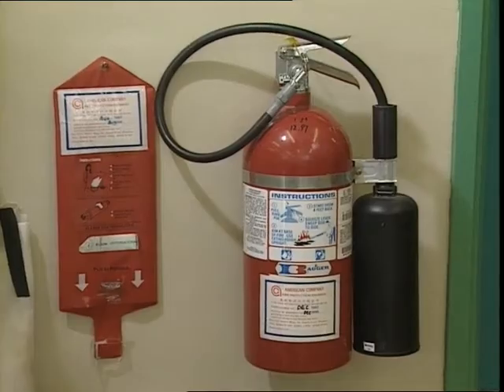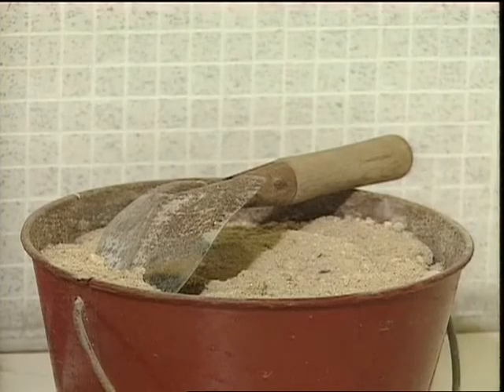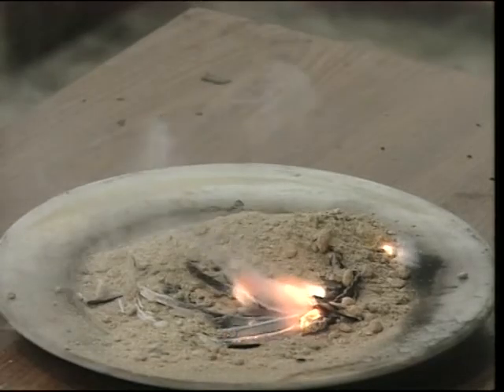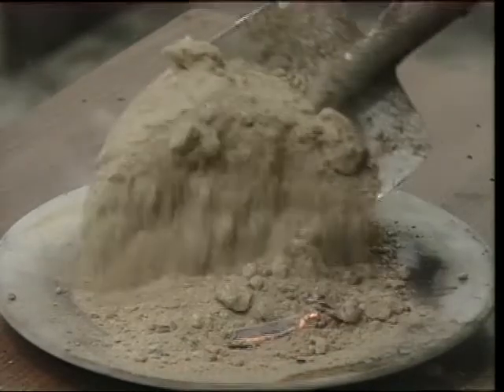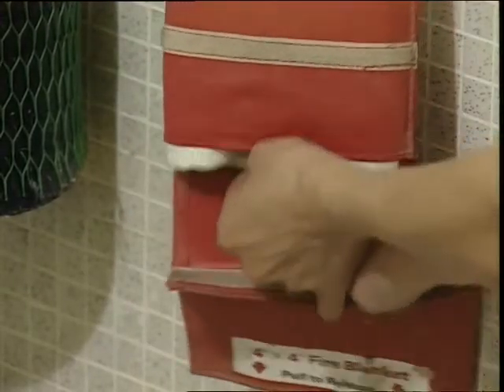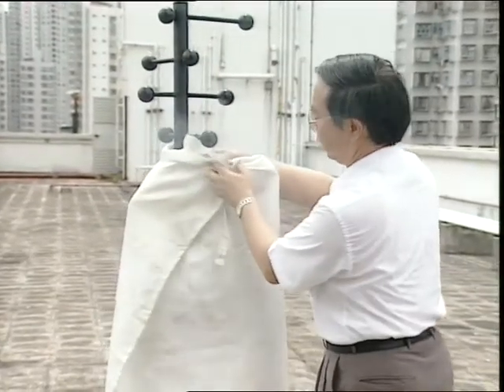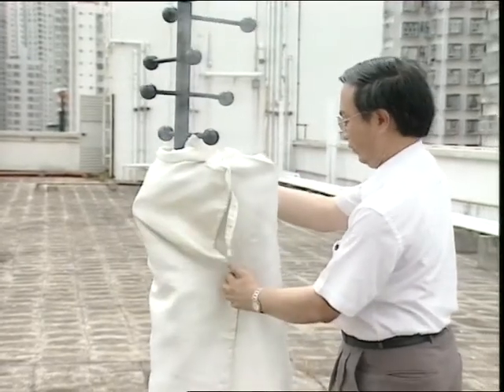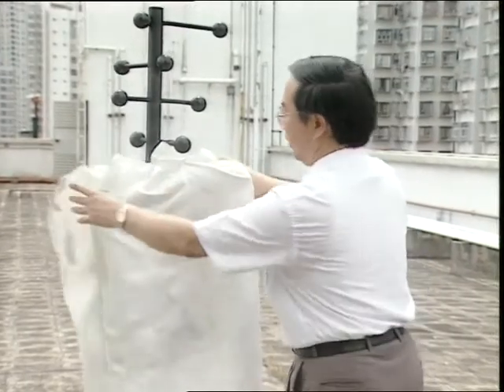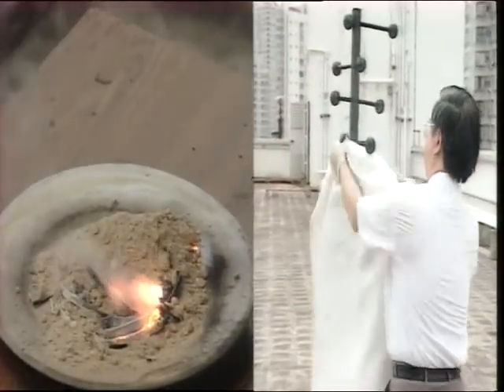Other than fire extinguishers, the sand bucket with scoop and the fire blanket can also help put out fires in the laboratory. Sand in the sand bucket is most suitable for putting out fires caused by chemicals. However, it can only put out small fires. The fire blanket is most effective in putting out fires on clothes, but you must take precautions to protect yourself when using it. Both put out fires by covering the fire to cut off the oxygen supply.